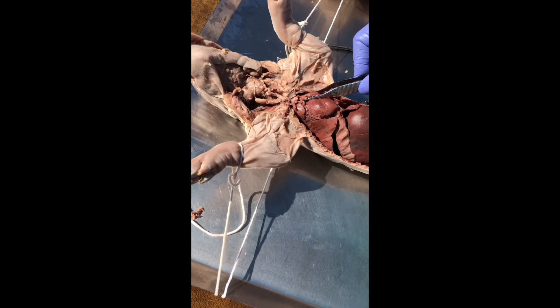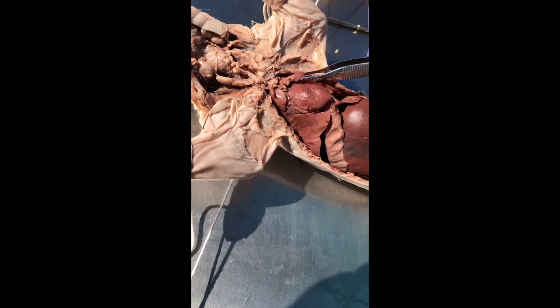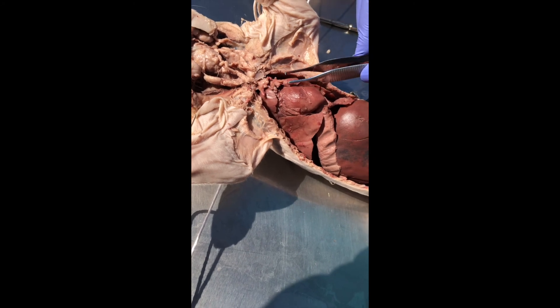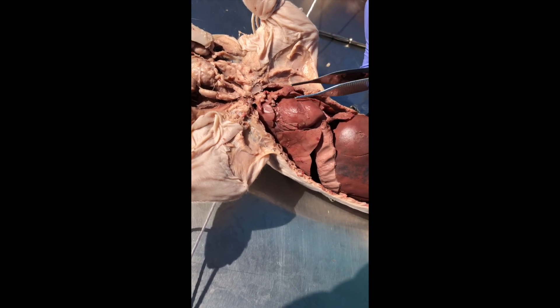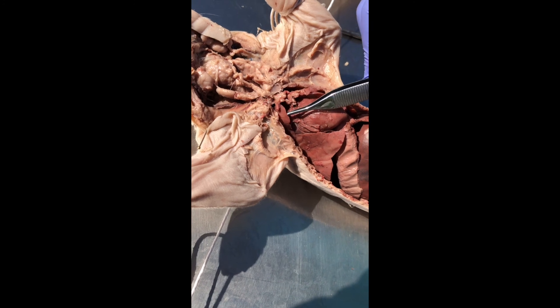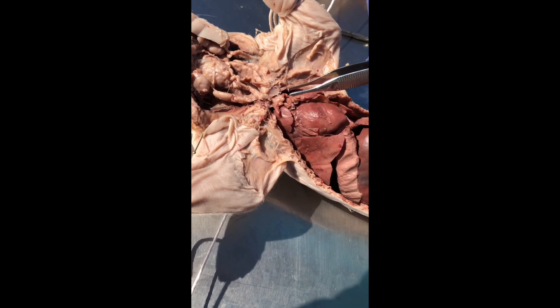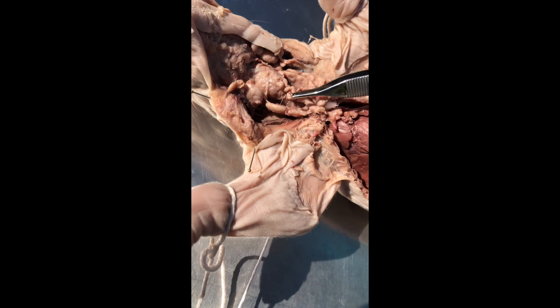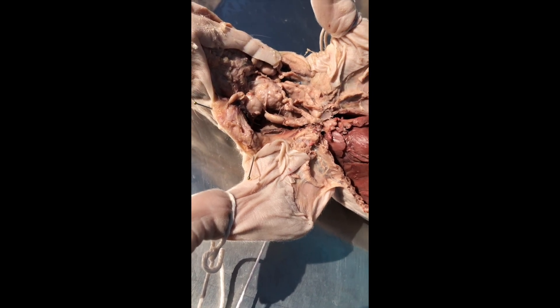And then a gland in the thoracic cavity — here's a nice review of thymus embedded in the pericardium, right here. This is actually a lobe of the lung right there, thymus embedded in the pericardium. And then you can also see relative to the thymus in the neck — that's it.